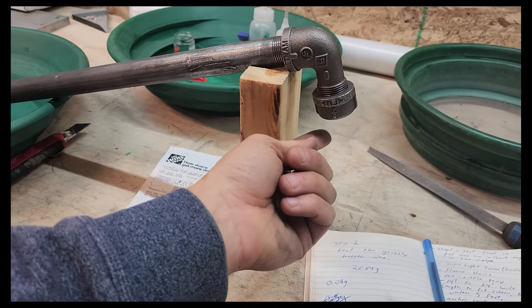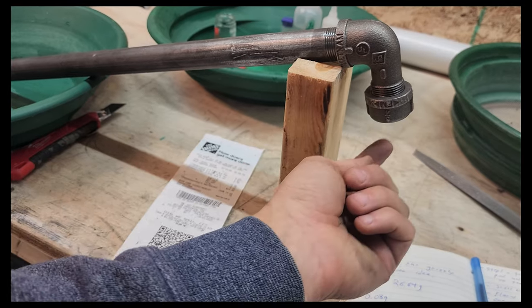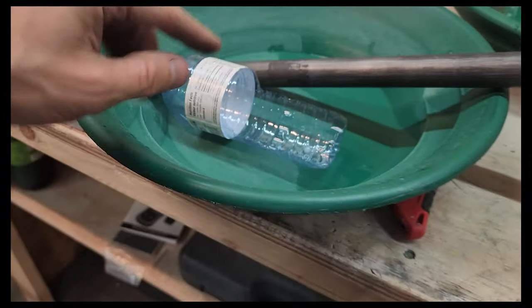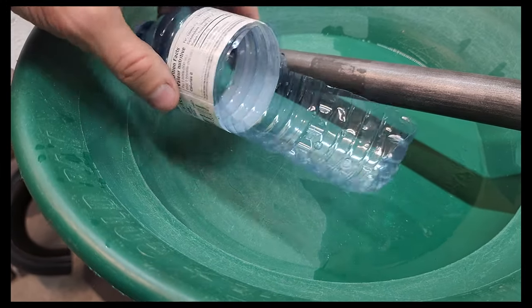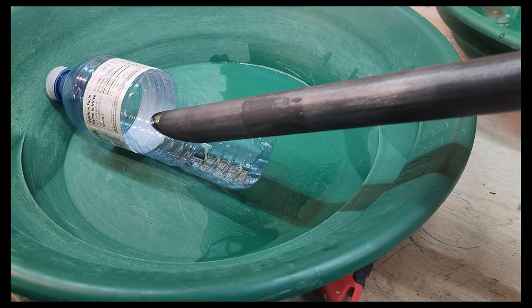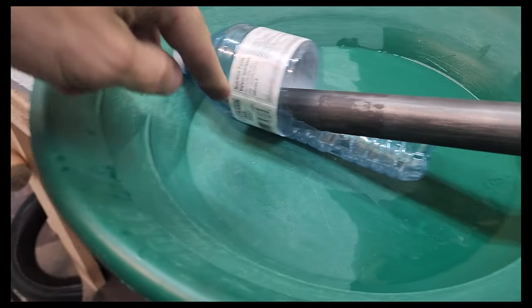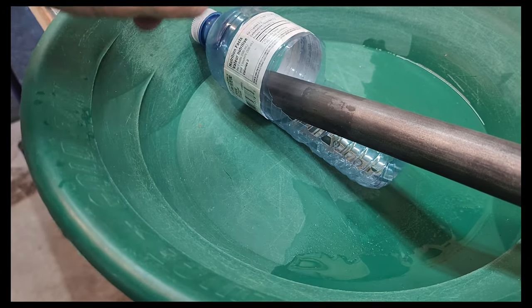What I'm going to do is put my mercury-covered gold into this cup, heat this end up, it's going to vaporize the mercury, and it's going to come down this tube. Then this water bottle — I've just sort of cut the water bottle open — and that's kind of important because you do want to put this end underwater so that the vapors don't just escape into the atmosphere.